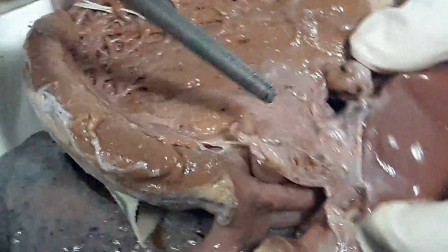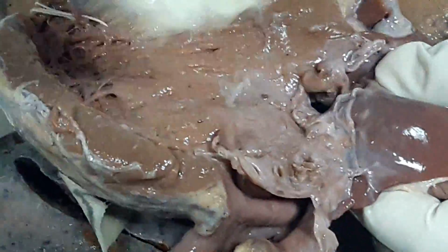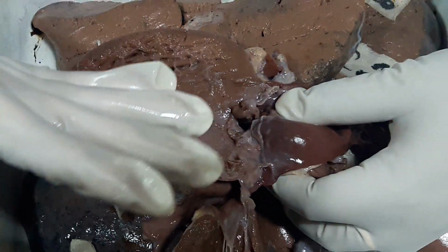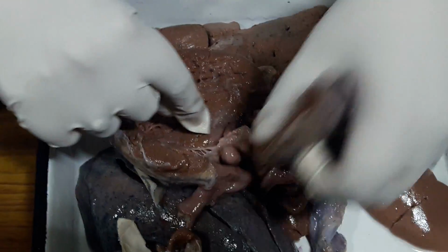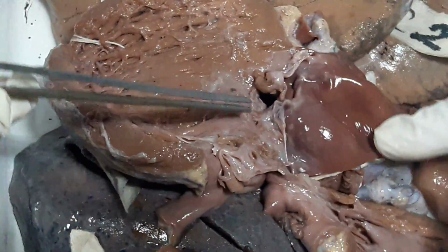Which one is the vegetation? Irregular patches. Actually, to start with, they are friable. Then because of handling, and this specimen is quite old, part of the vegetation you will not see. But you can see that irregularity in the surface. Okay, and then this anterior leaflet is also abnormal. So the under surface is showing presence of vegetation.